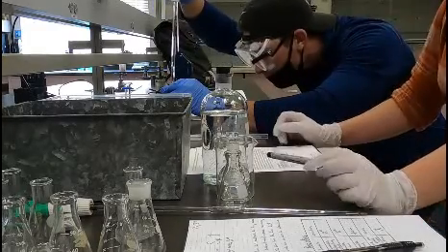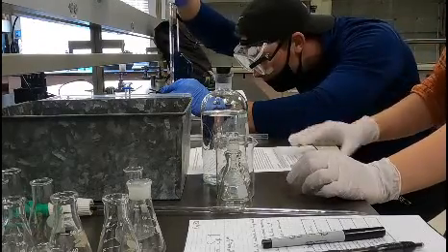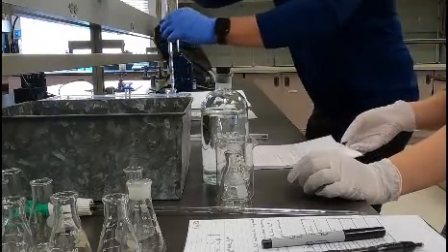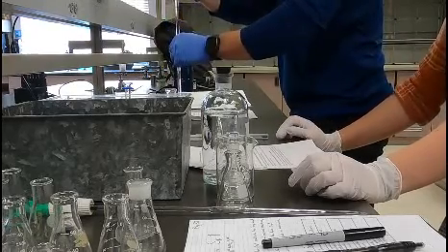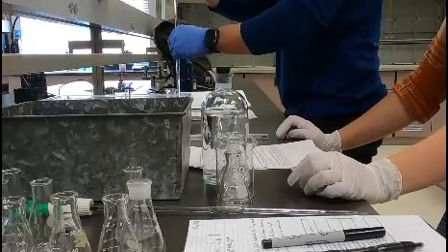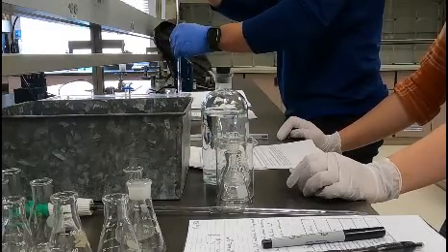The base — NaOH — the base is being exhausted. I kind of have to talk out loud for the video. I want them to understand why we're going to see it go from blue to green.